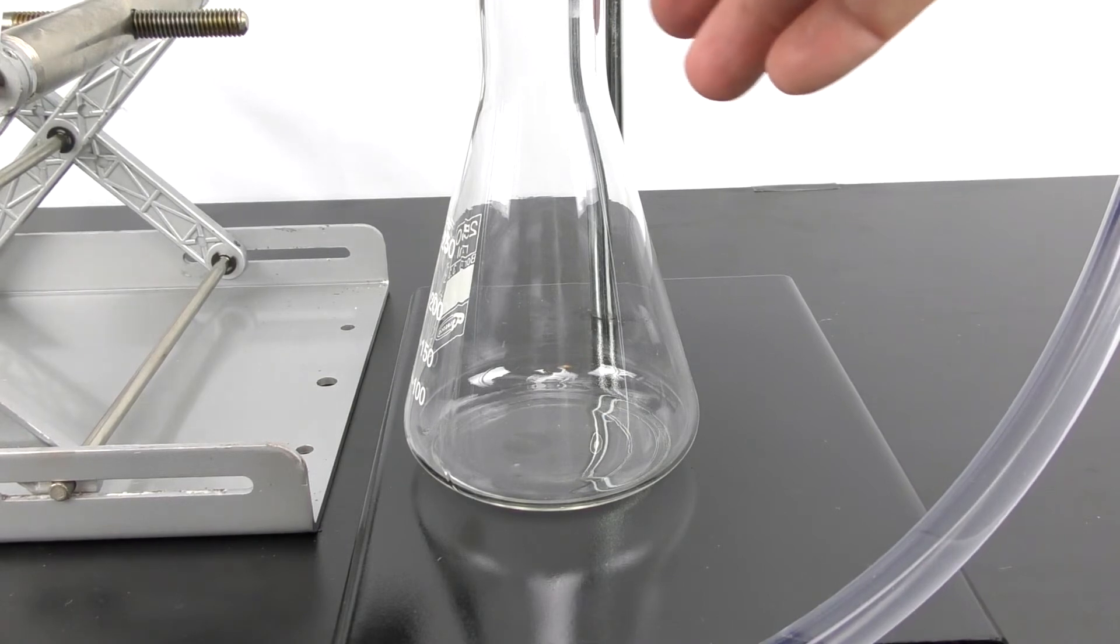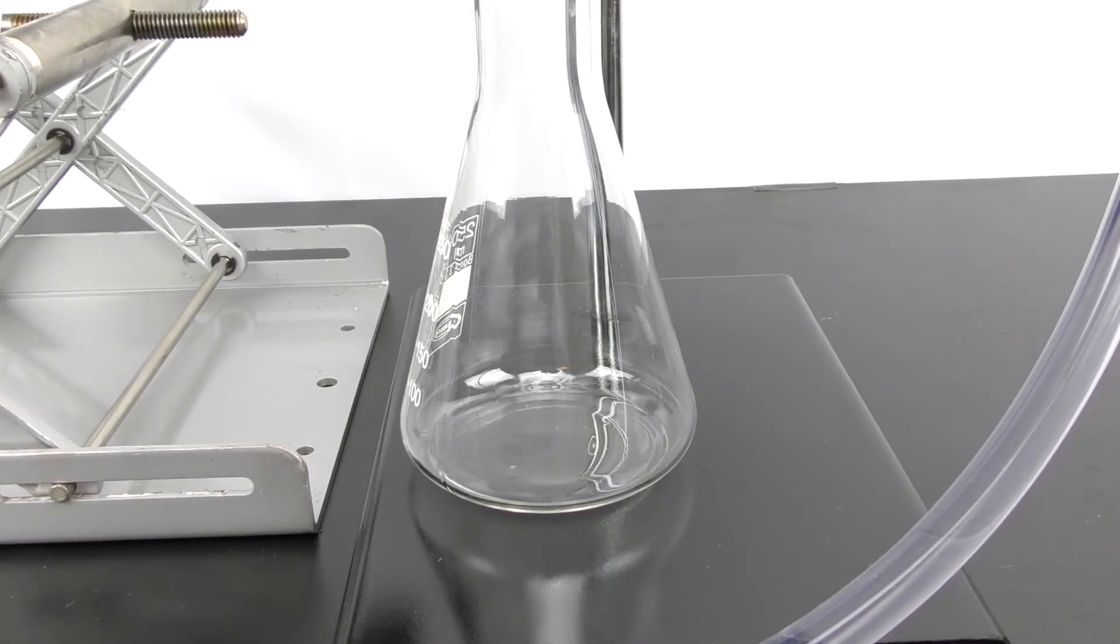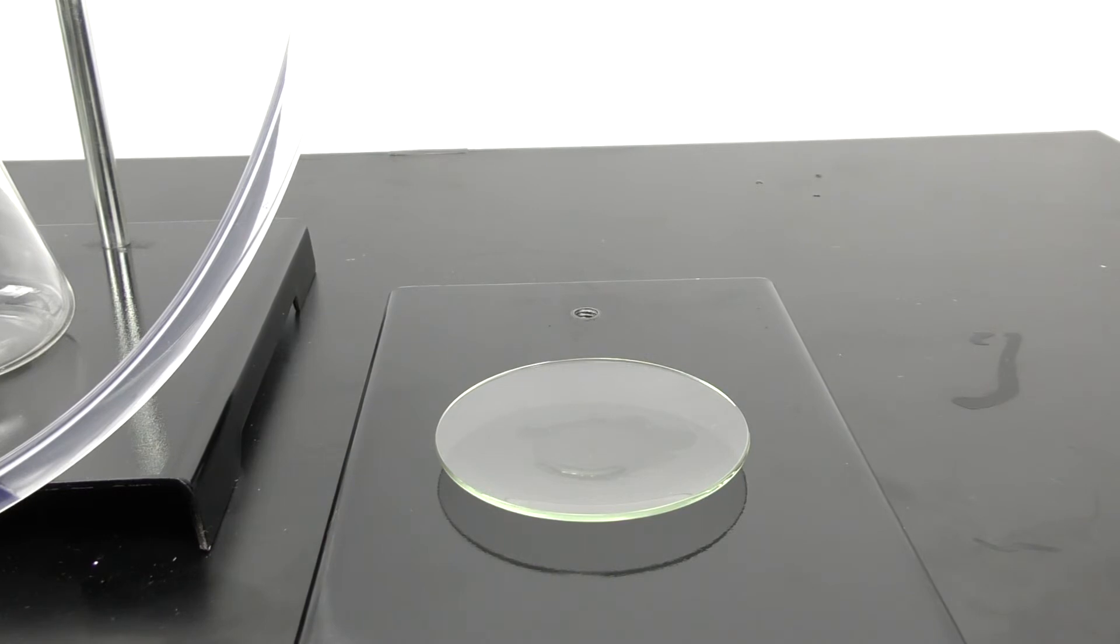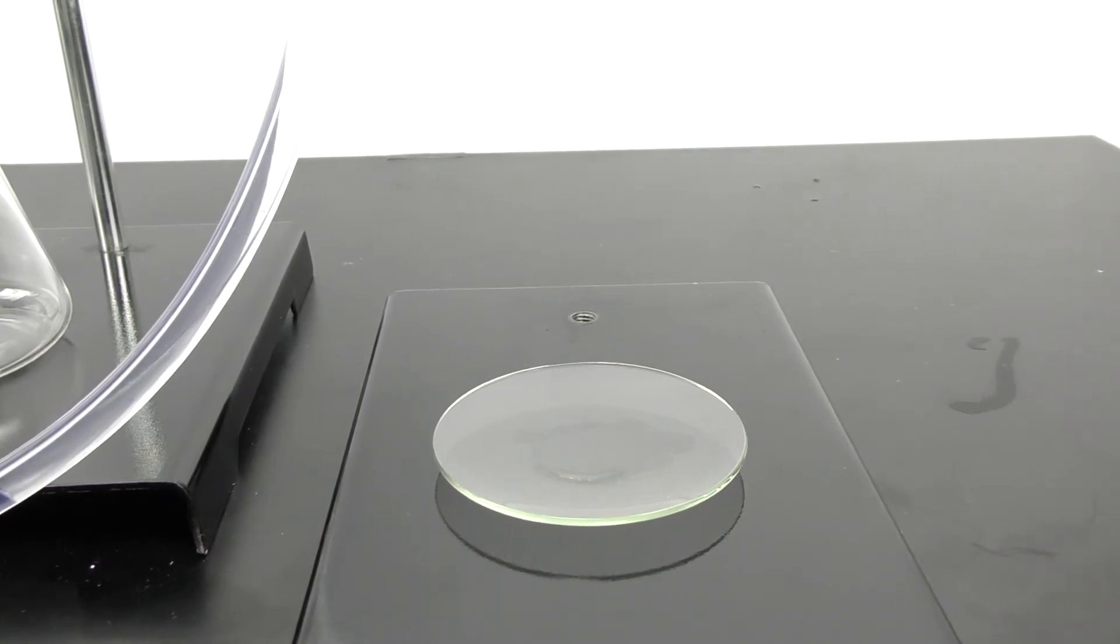And I know you can't smell this but it is definitely alcohol, it is not water. Here just to show you what came out of that, I poured a little bit of the liquid distillate in this watch glass. It is definitely alcohol and not water.